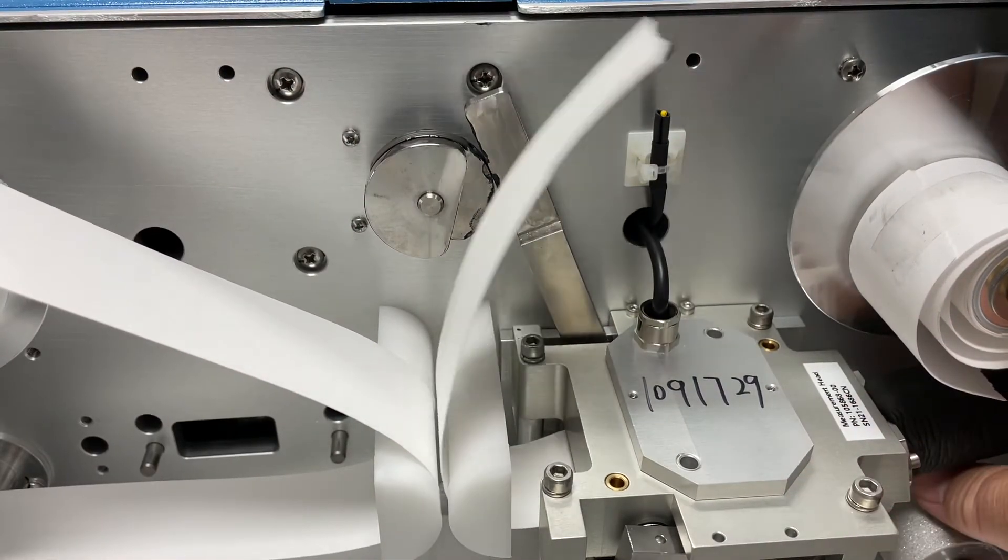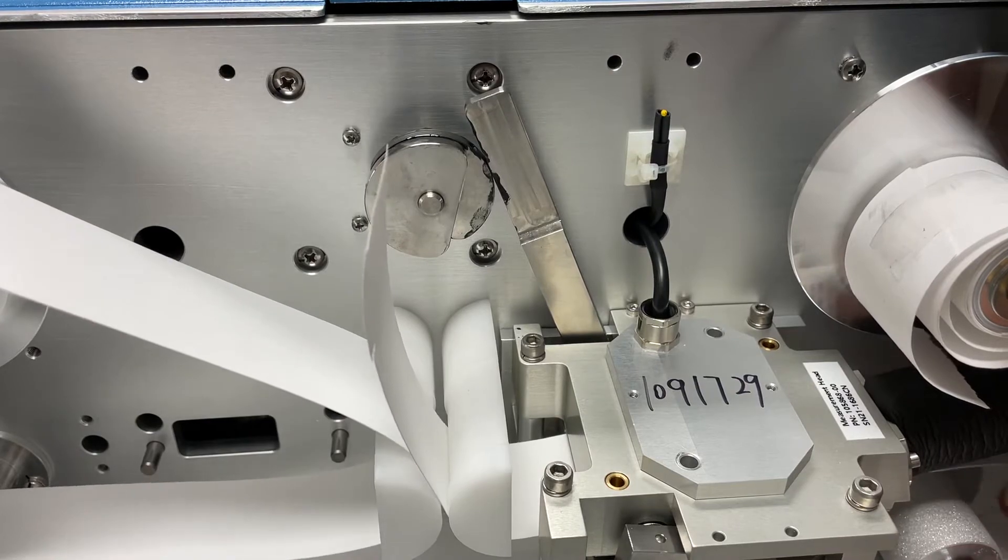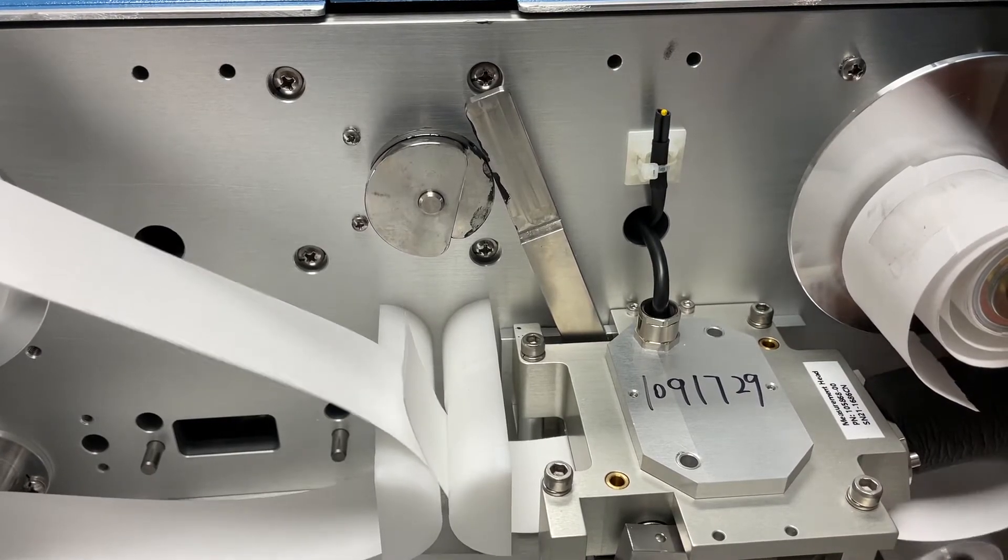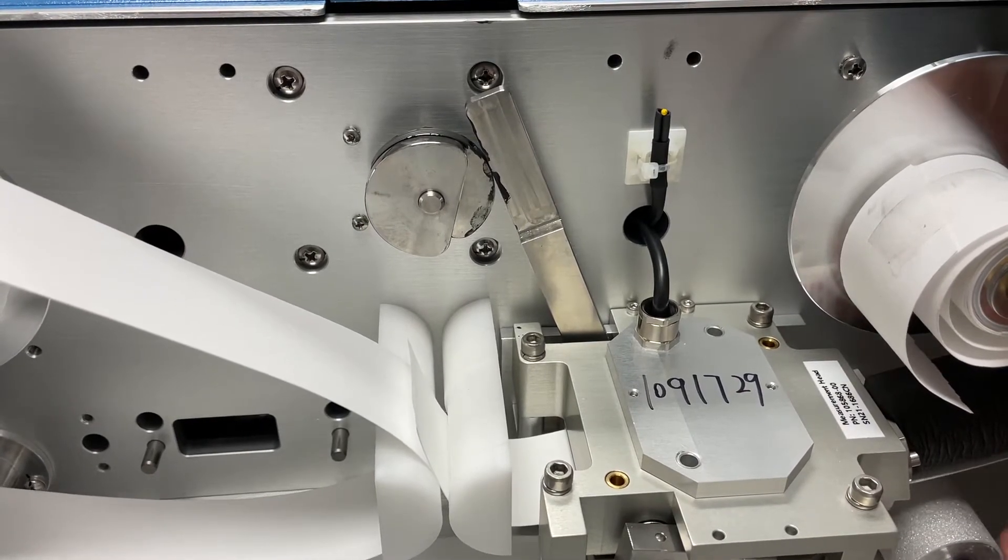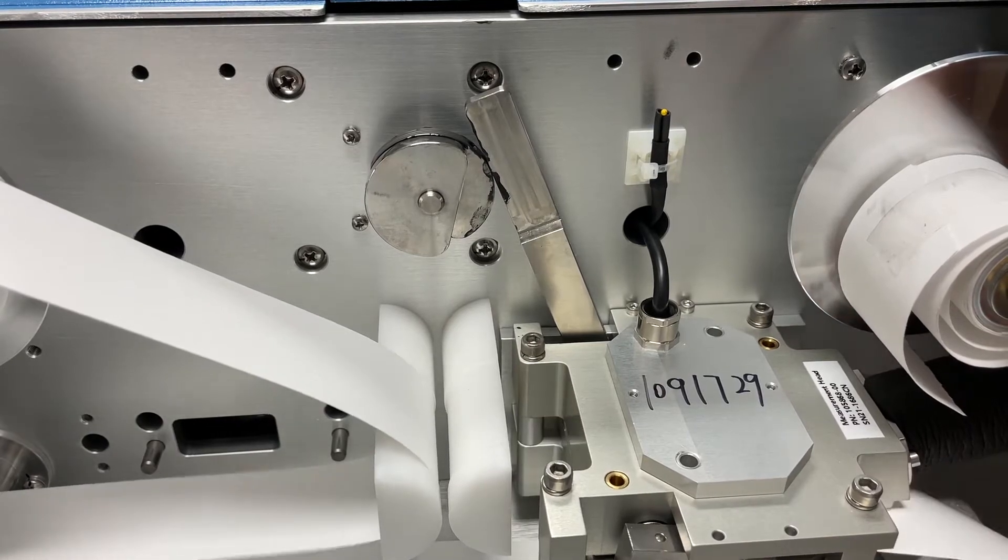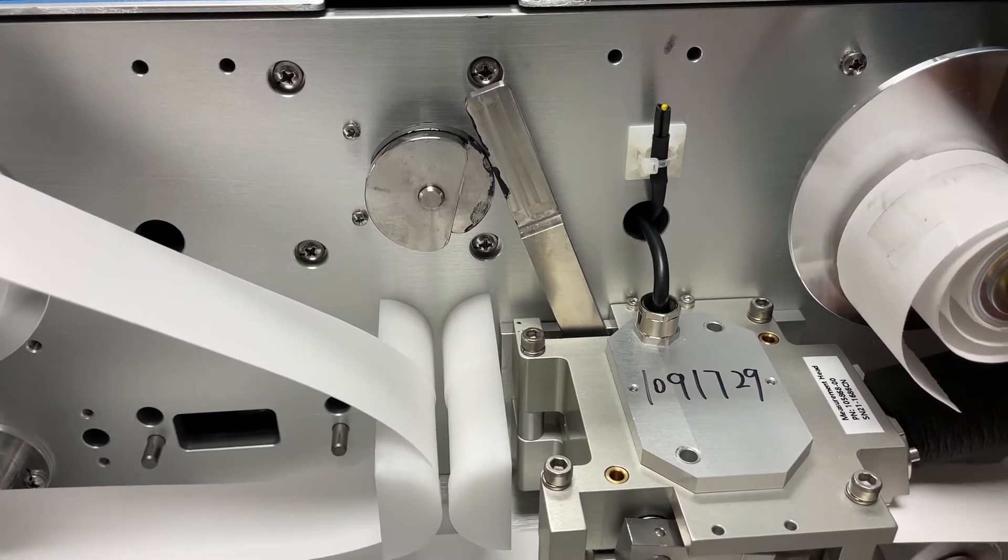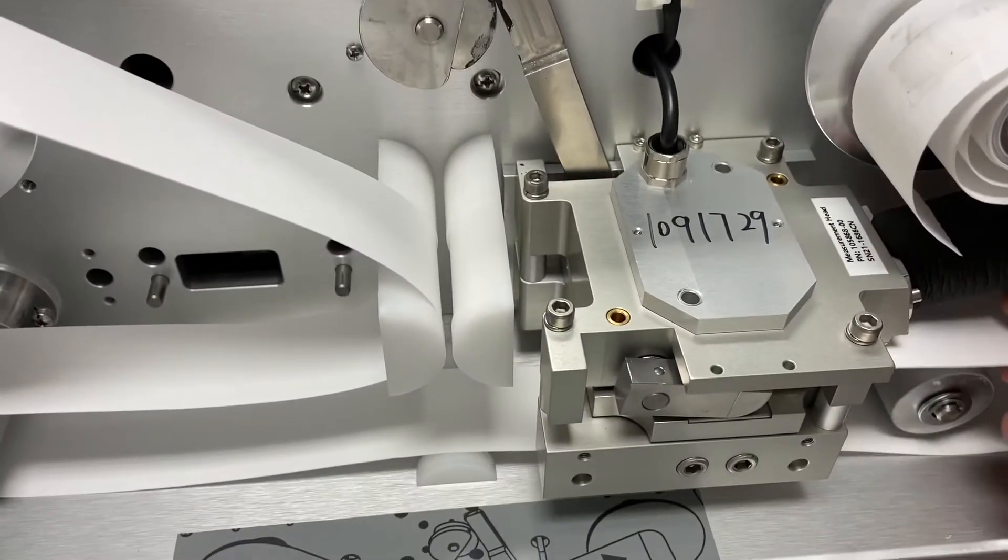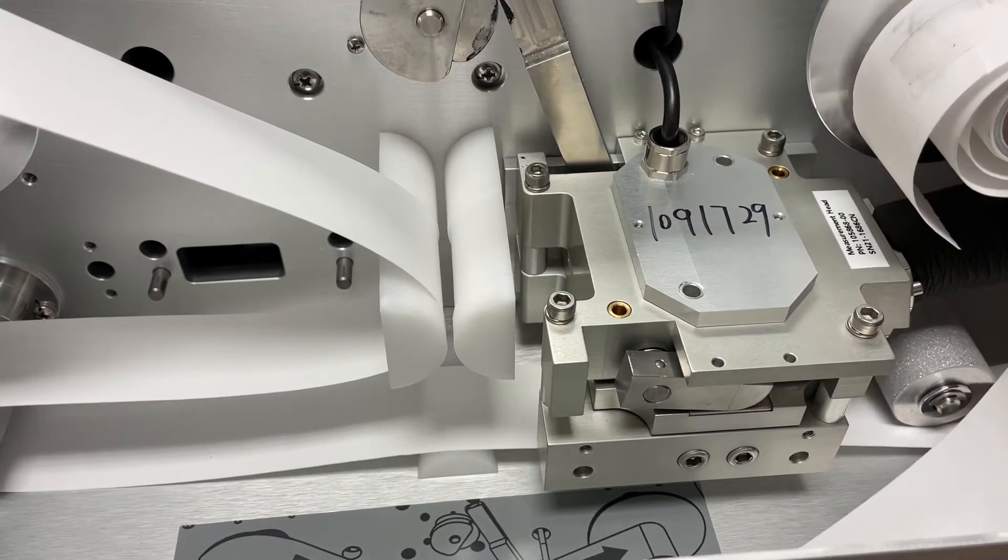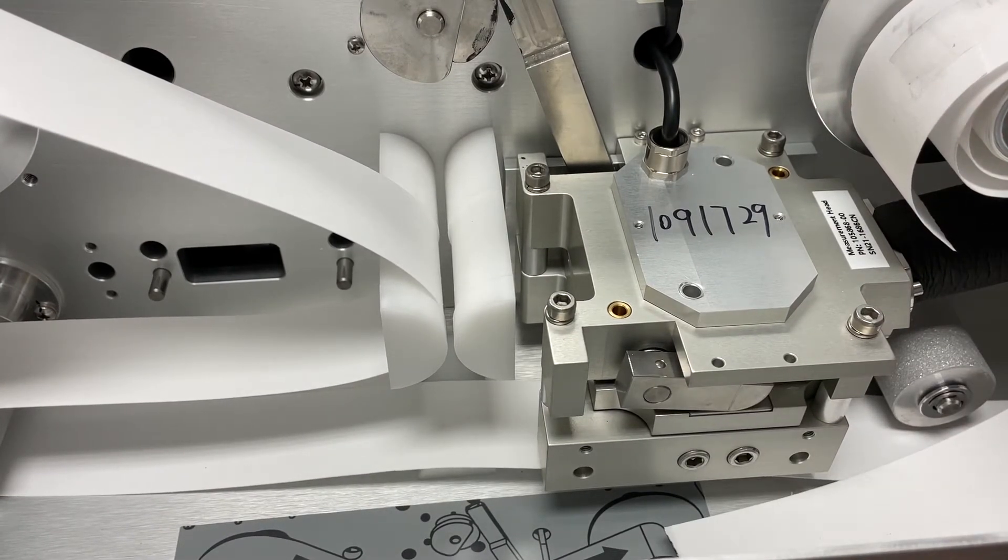We can slide the tape out of the detector head. I'll just pull it from the right and feed it out. You can just set it aside once you get it out.